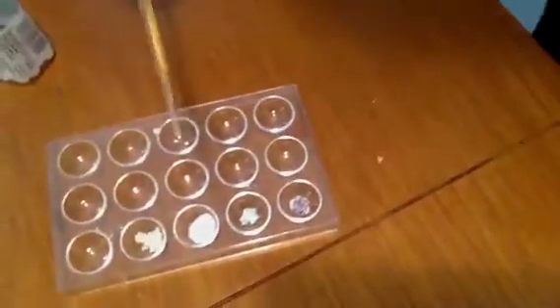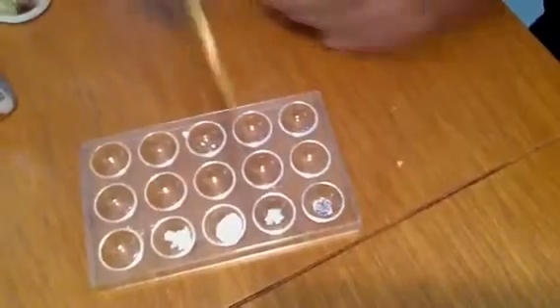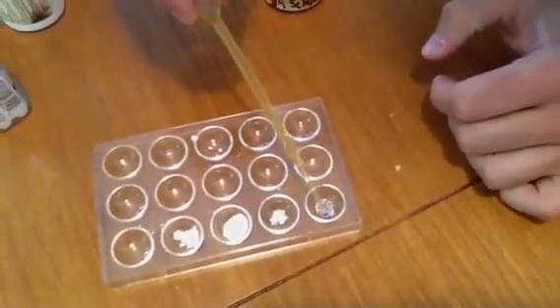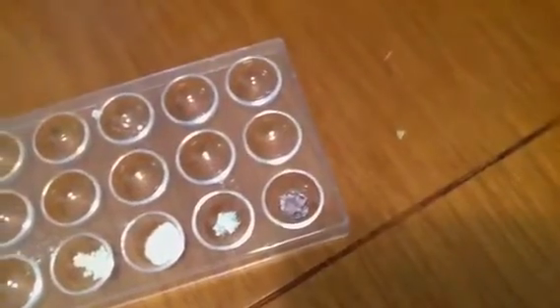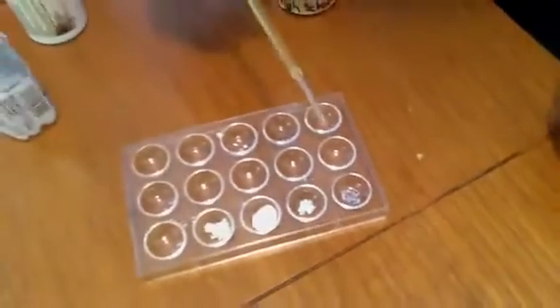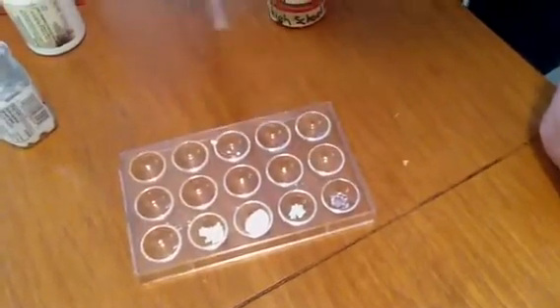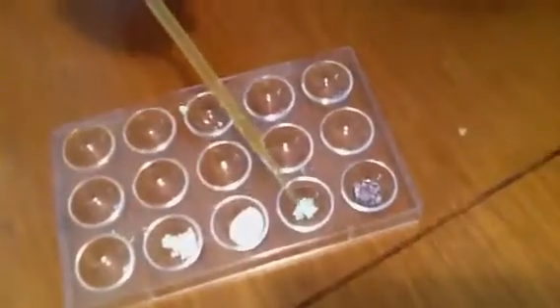Okay, so back to the reaction with the aspirin and the iron nitrate. You guys see what it looks like there? It turned a nice little purplish color. So we know, according to our prelab, that when aspirin reacts with iron nitrate, it's going to turn purple. Here we've got our Tylenol. We're going to see what happens.